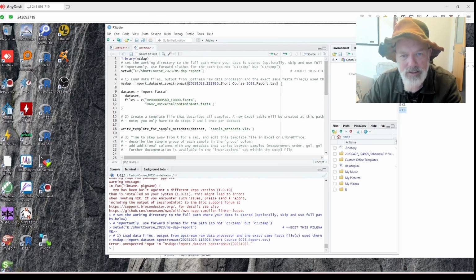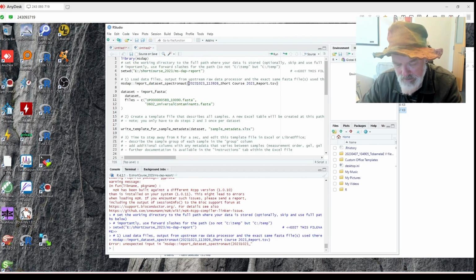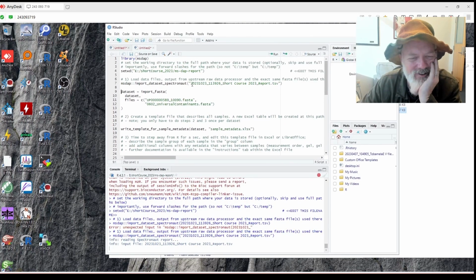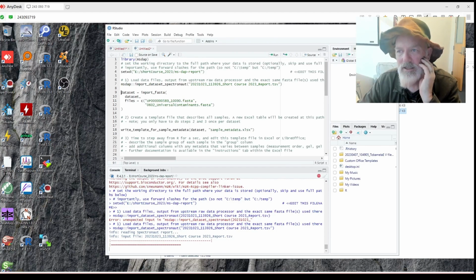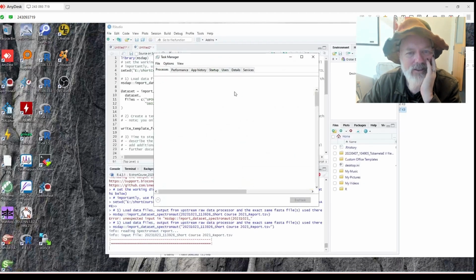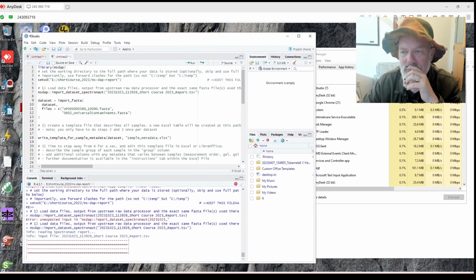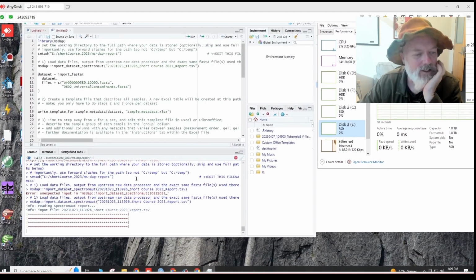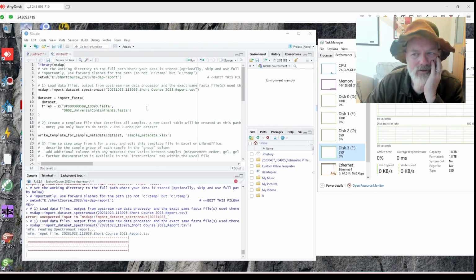Okay, so let's see. Do I need, probably, I believe I might need, let's see if that works. Yes. Okay. So don't forget to put the quotation marks. All right. It's loading. This is an SSD. So what I also like to do, because I'm a geek, is I like to watch it running with the task manager just to see what it's doing. See, it's on my E drive, so it's not even using it very much. And having an SSD helps you with loading it. All right, so let's see. So far, so good.